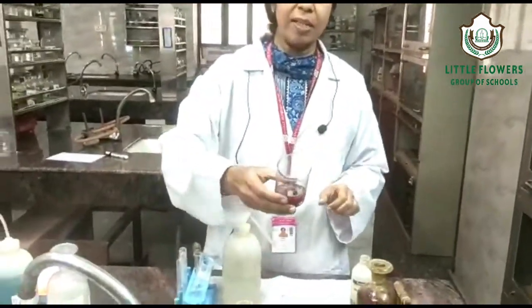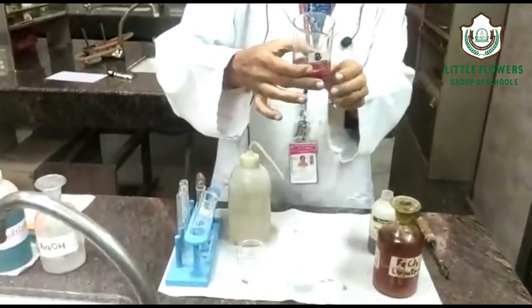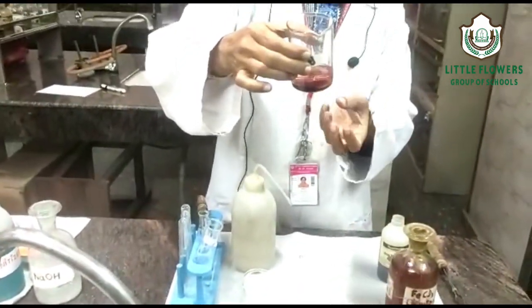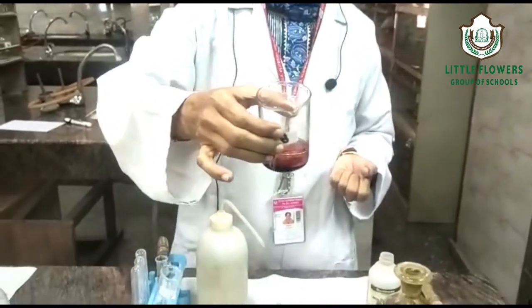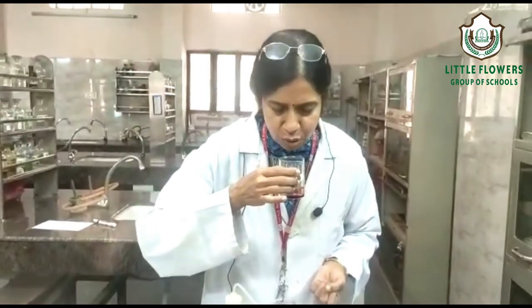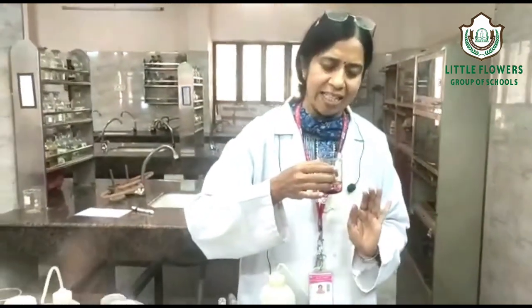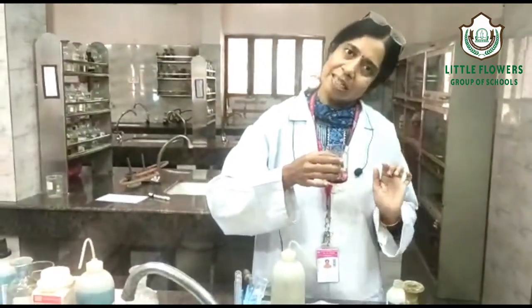Physical observation: see color — it is a reddish or maroonish liquid, soluble in water. Odor — yes, there is odor. If you feel there is odor but are not able to identify it, you can write what the odor is.